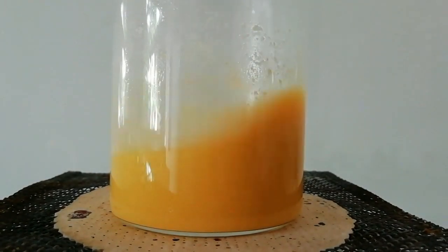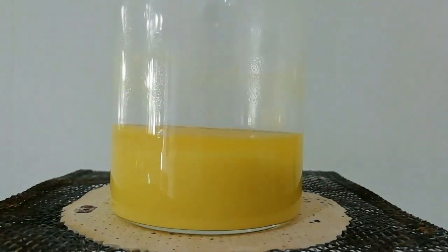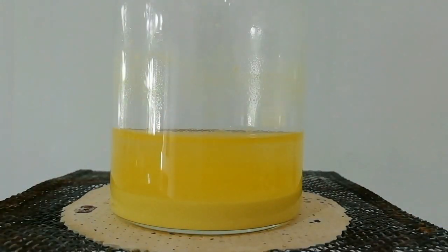When the white precipitate turned into yellow color, heating is continued for another 5 minutes.